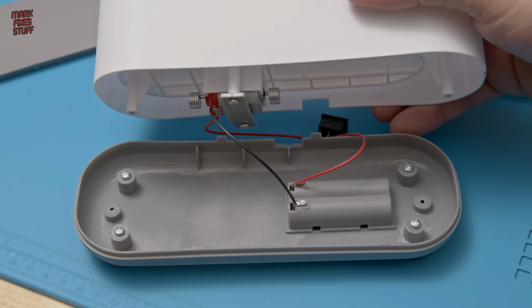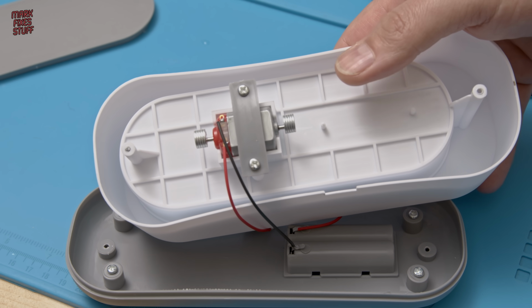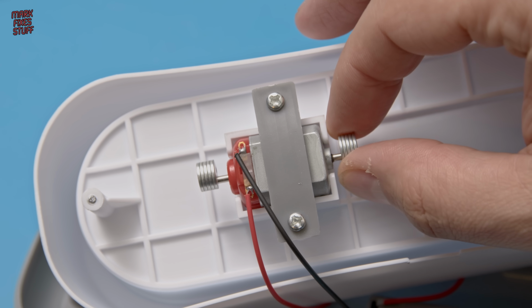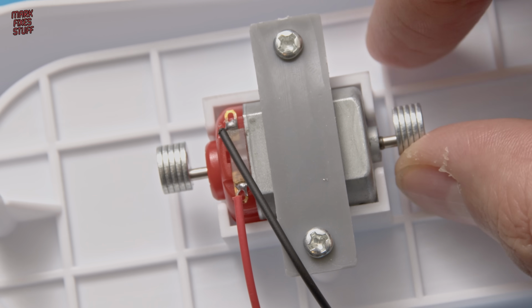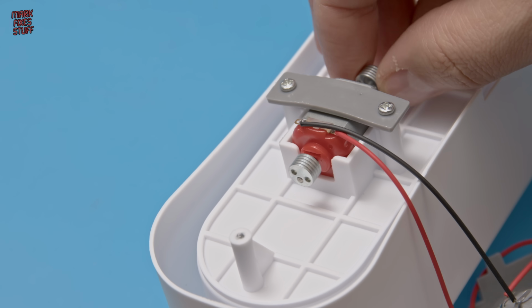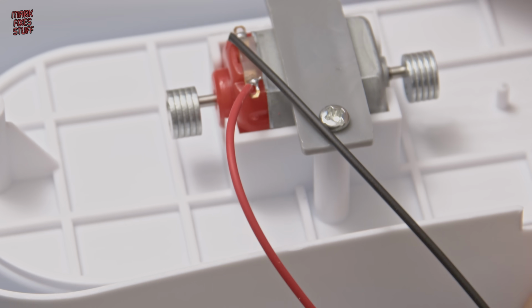Let's look at the main event. And that, my fellow fixers, is dishonest by design. Rather than a 40 to 45 kHz transducer welded to the bottom of a steel tank, we've got what looks like a cheap 3-volt motor out of a cheap gaming controller. It's literally designed just to vibrate the case. We haven't got an ultrasonic cleaner here, we've got a water wobbler.